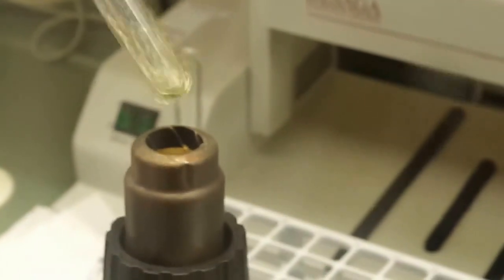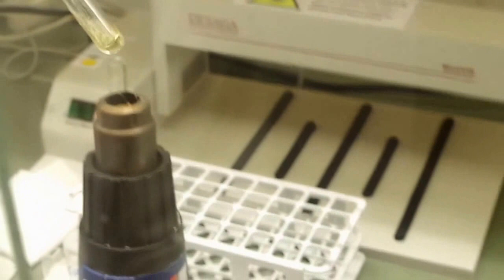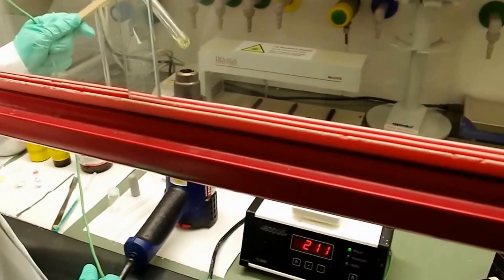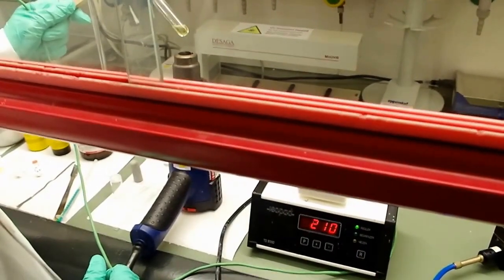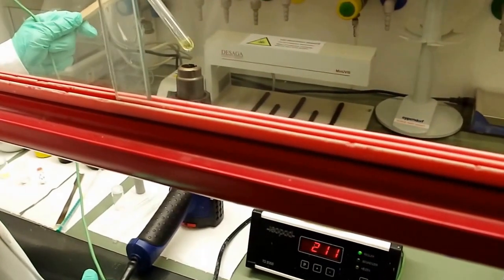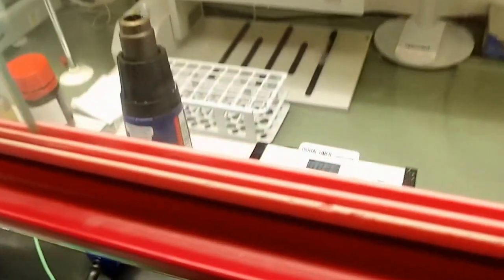This time we should control the temperature. It should be around 200, so we avoid going much higher. Therefore I lift my arm a little bit, so that I can keep the temperature between 200 and 210. The particles grow. No black precipitation, very nice. Okay, now we have half time, 2 minutes 30 seconds passed.